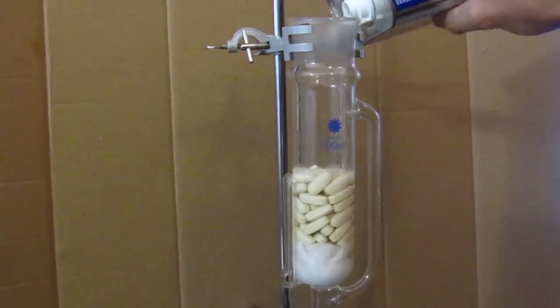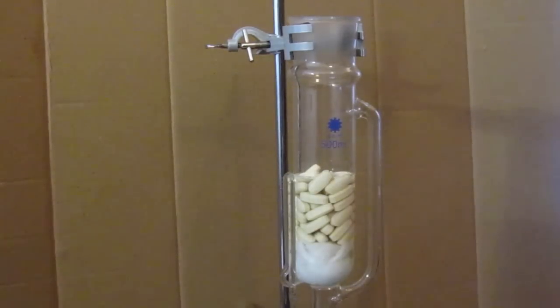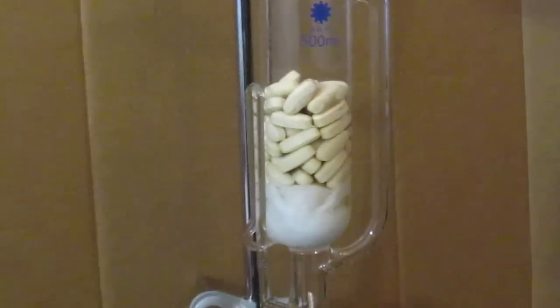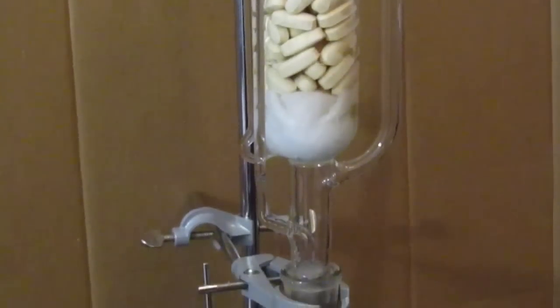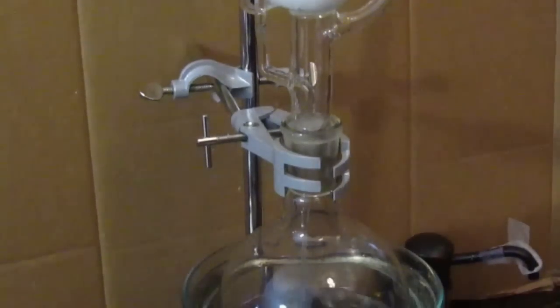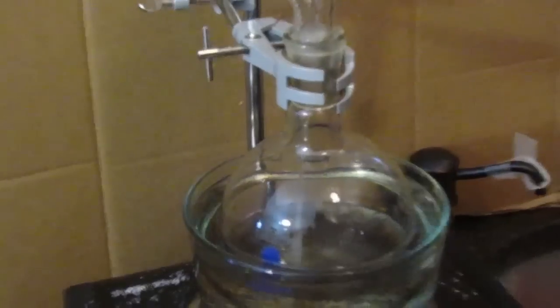Now what you want to do is add like three volumes of solvent into there. Make sure that your pot won't boil dry. Let it cycle through three times, and then you know you have enough solvent in there.